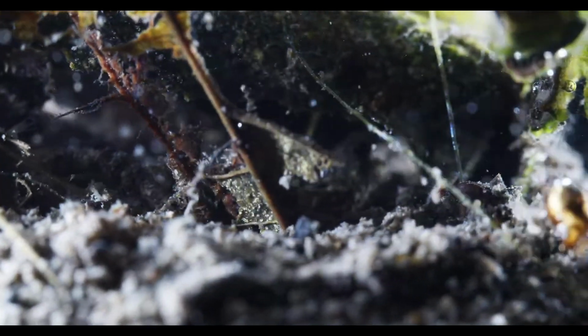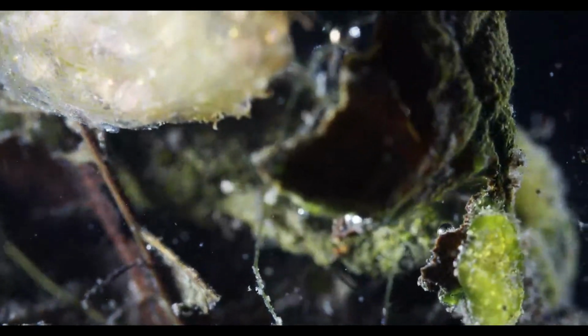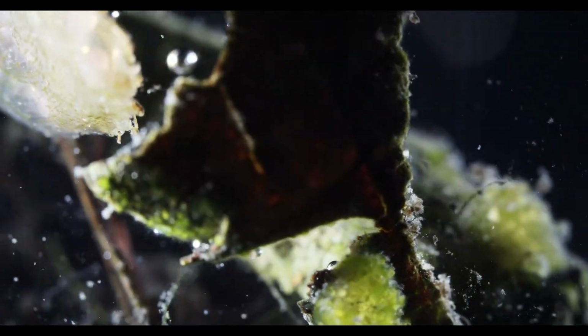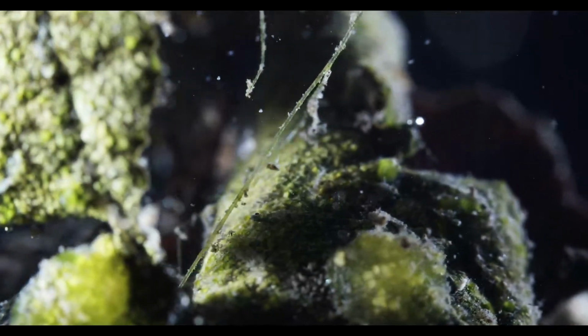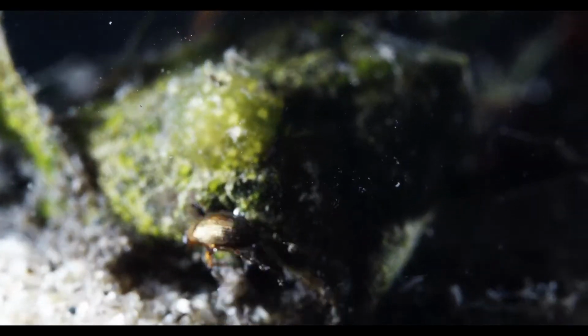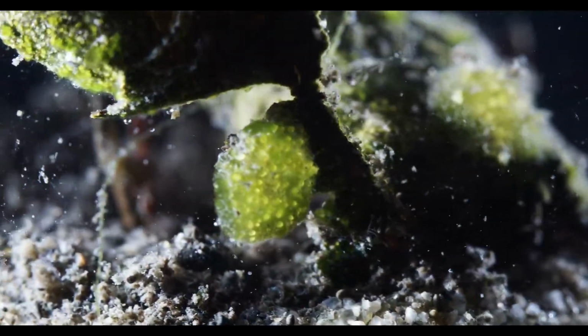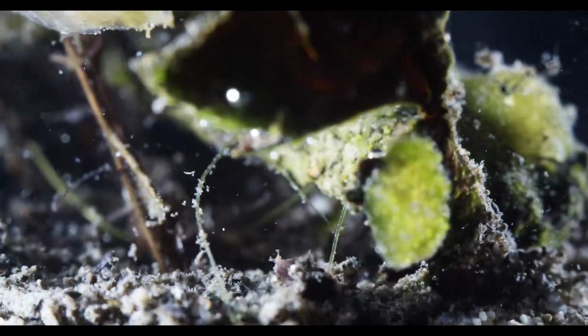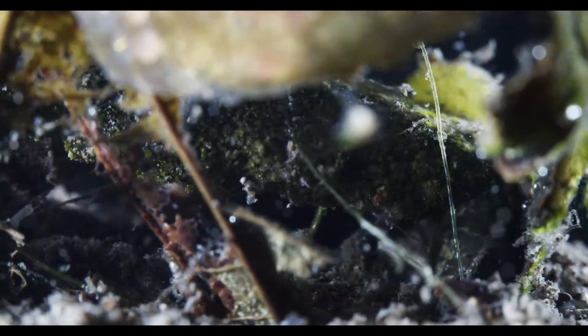And he's so fast that I can't really observe him hunting yet. I'll improve the machine in coming time. Might never be really finished. Yeah, beginning to have doubts if we can get a really good look at him.